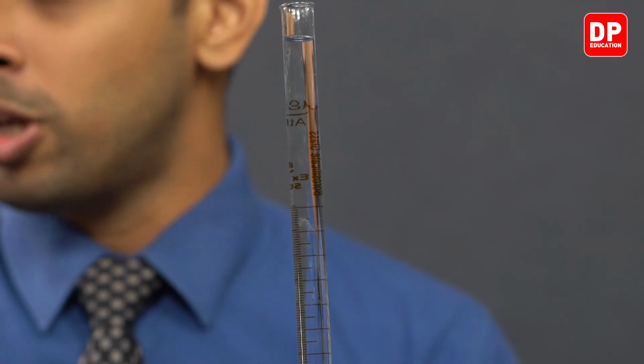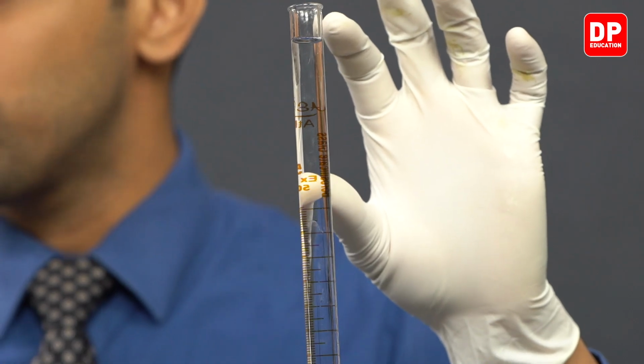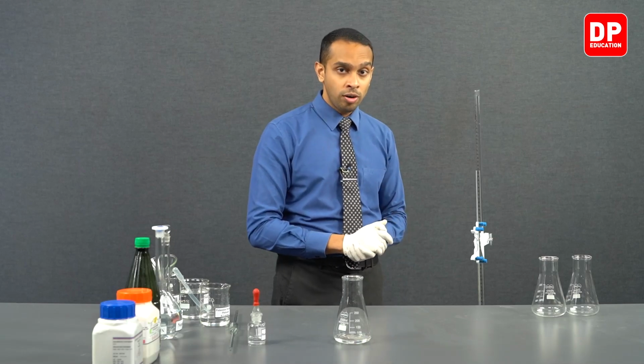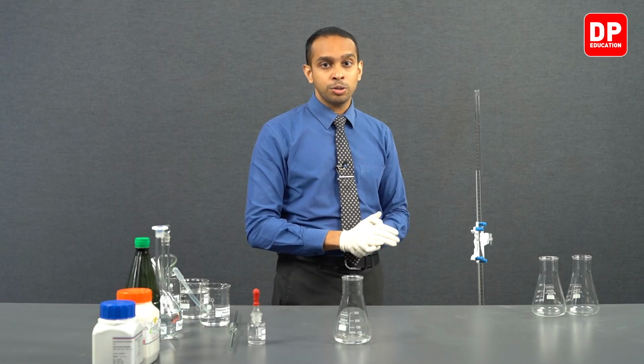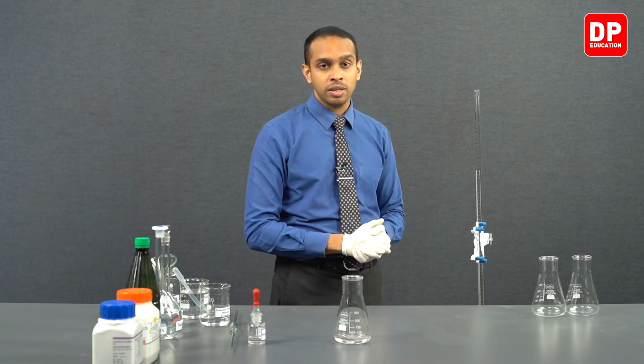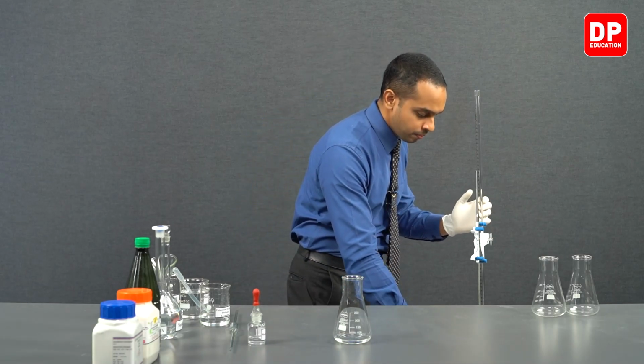As you know, when we washed this burette with sodium hydroxide, we made sure the tip of the burette remained empty. When you are filling the sodium hydroxide into our burette, we have to take a little bit of an excess amount, so that when you are trying to fill the tip area of the burette, you have enough volume to drive out the air bubbles that are found in the tip of the burette. So let's take the burette here.